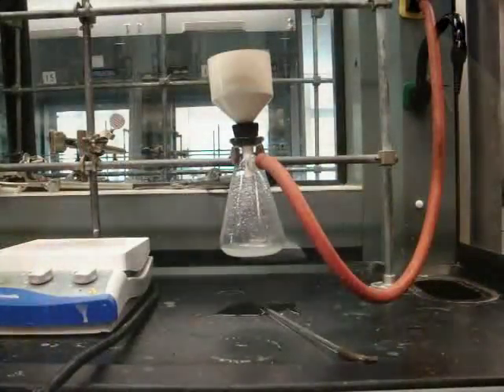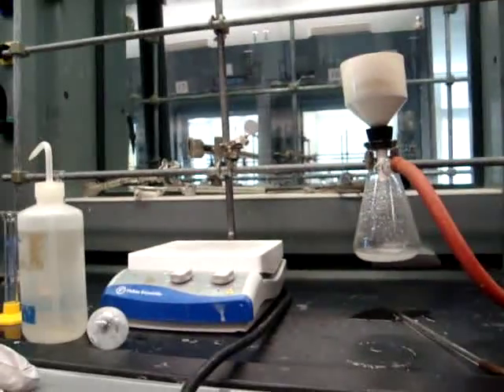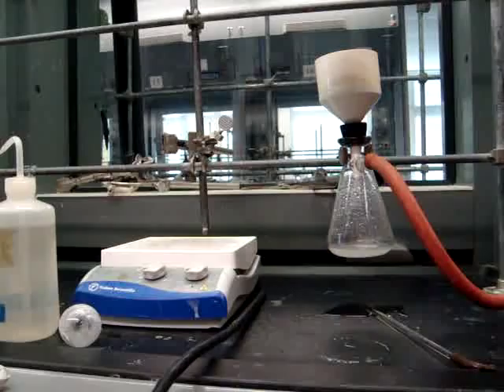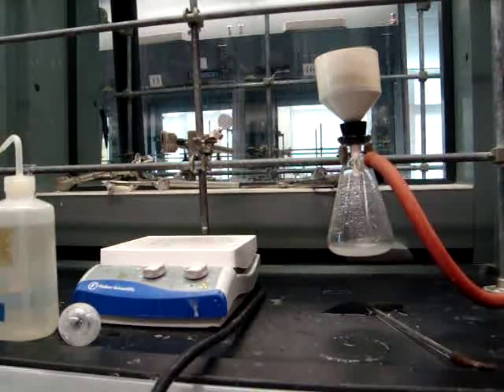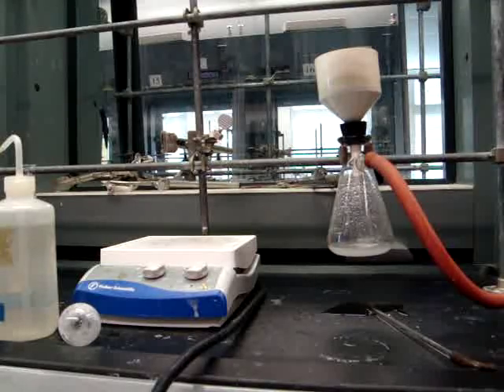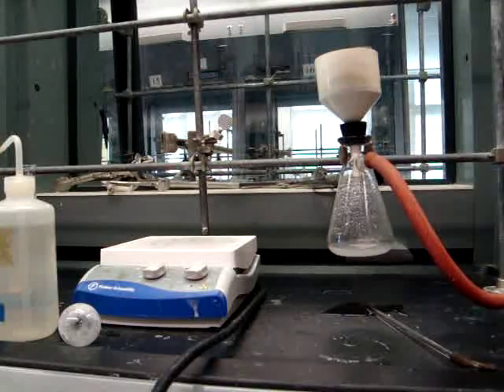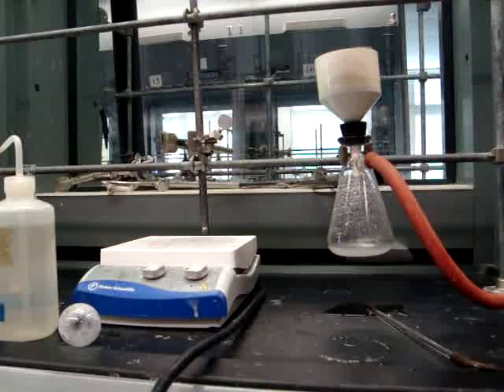We will be adding 7ml of diethyl ether. You want to make sure you use the wet ether found in the supply bottle in the dispense hood. Also, diethyl ether is extremely flammable, so make sure there are no flames or hot plates near the ether.